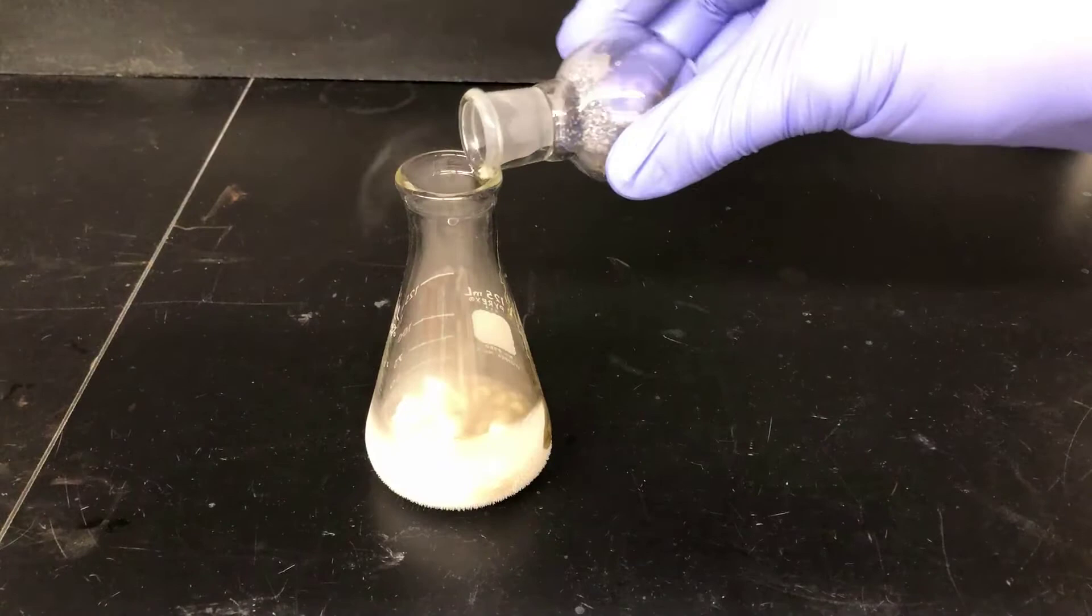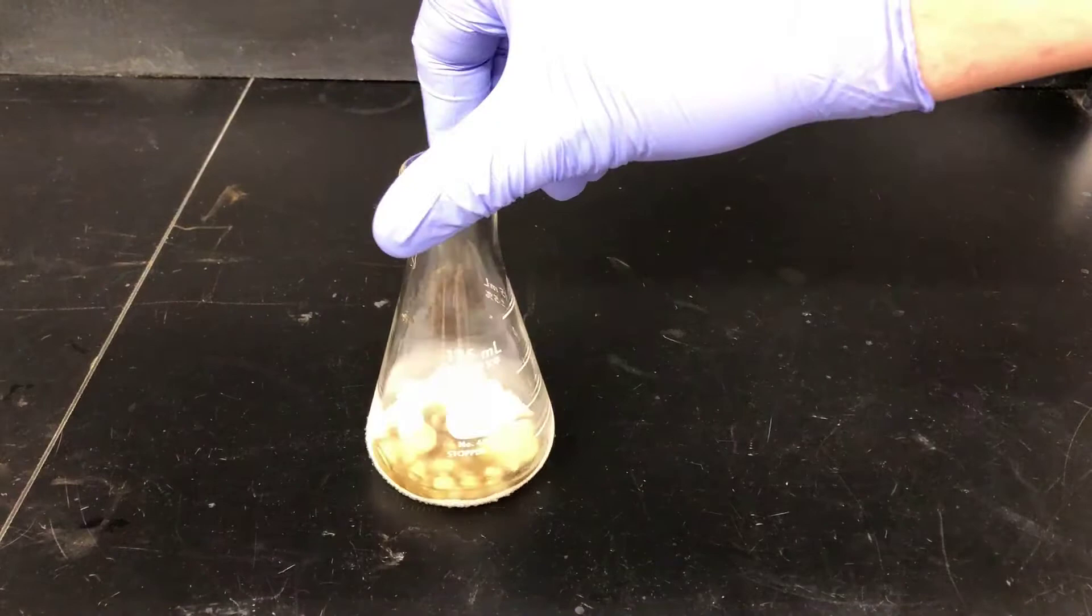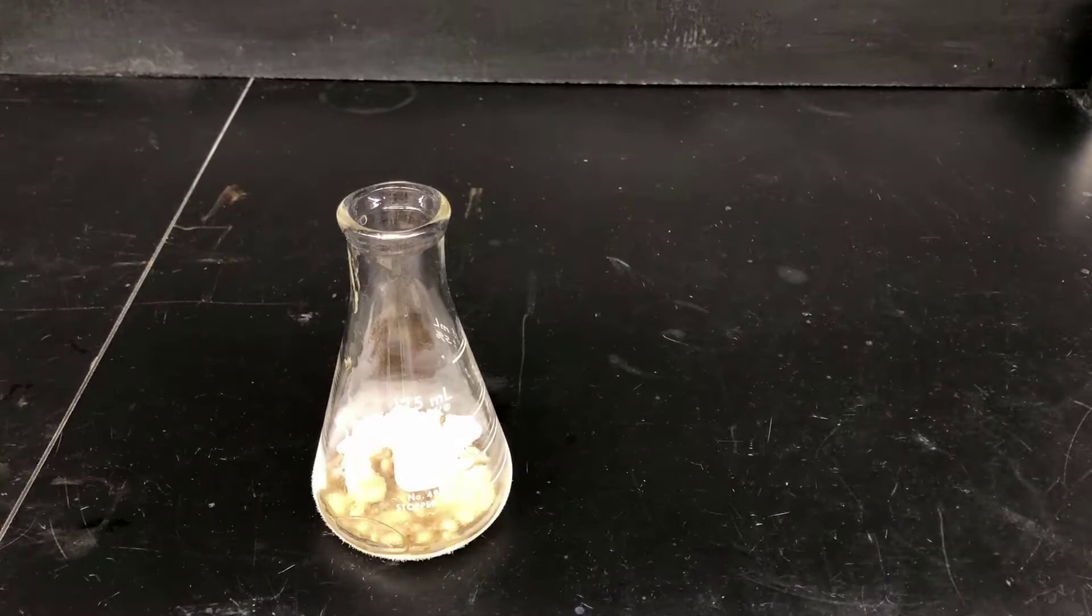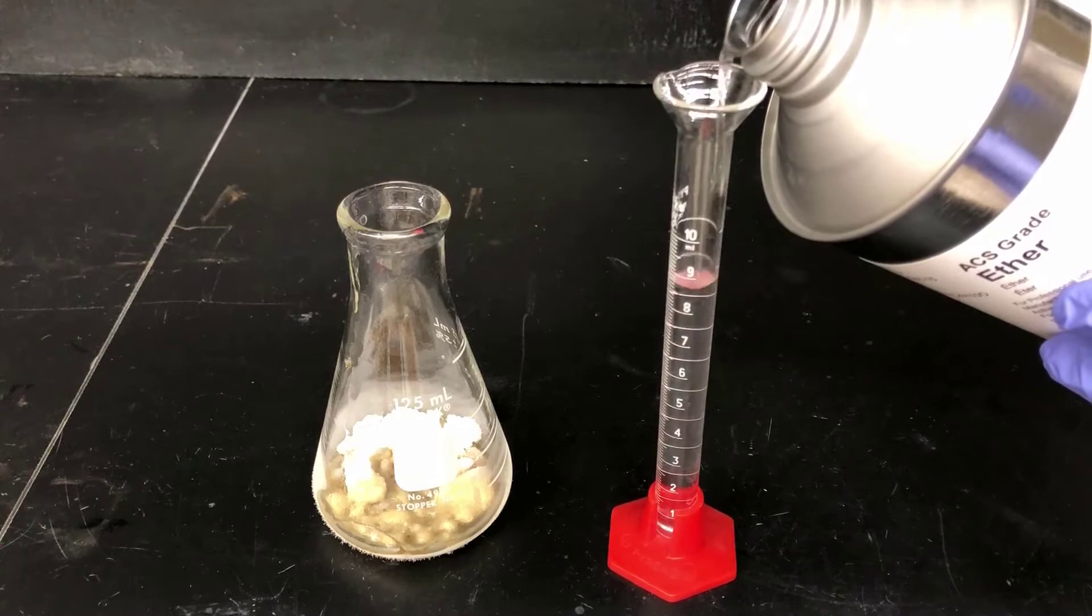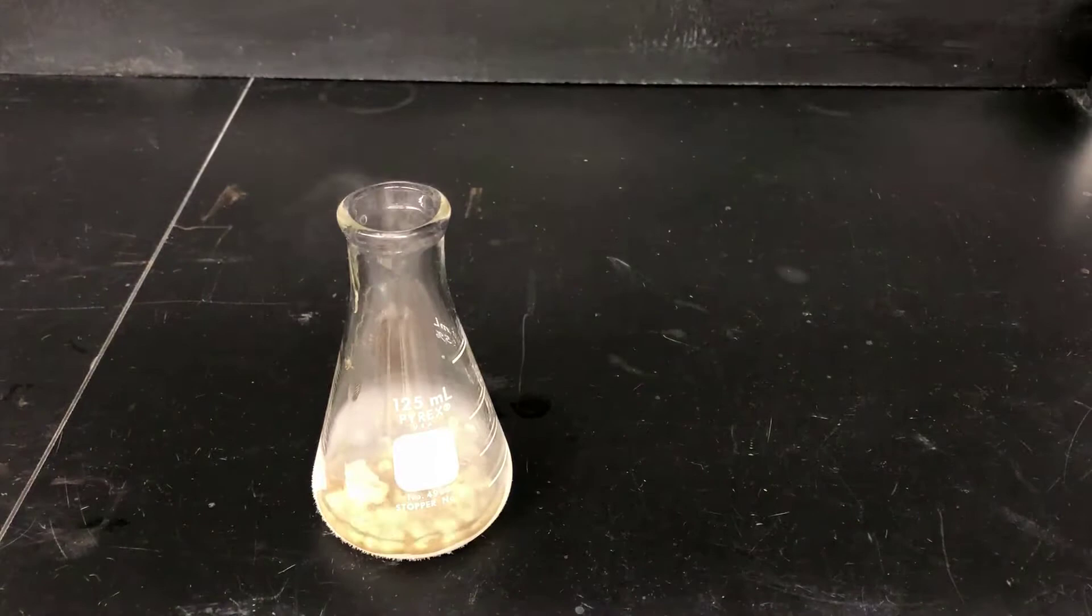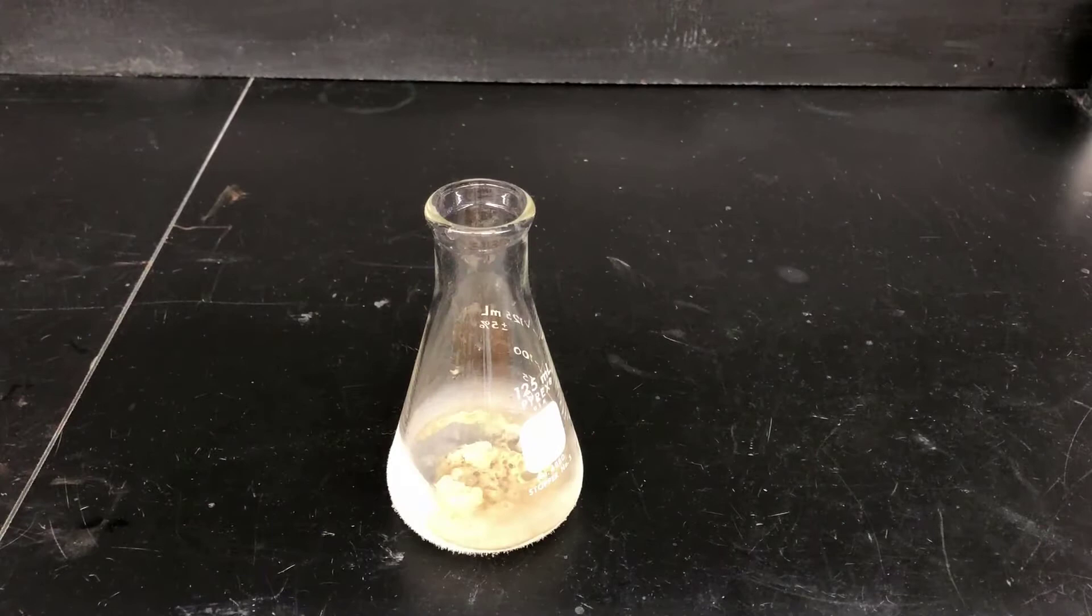The reaction is a thick, gooey, gurgling blob at this point. To make the reaction mixture easier to handle, I'm going to be diluting it out with some ether. I'll measure out 10 milliliters of anhydrous ether and add it to the reaction mixture, and I'll swirl it around. The bubbling is caused by carbon dioxide subliming, going from the solid phase to the gas phase. That bubbling will continue until all the CO2 is gone.